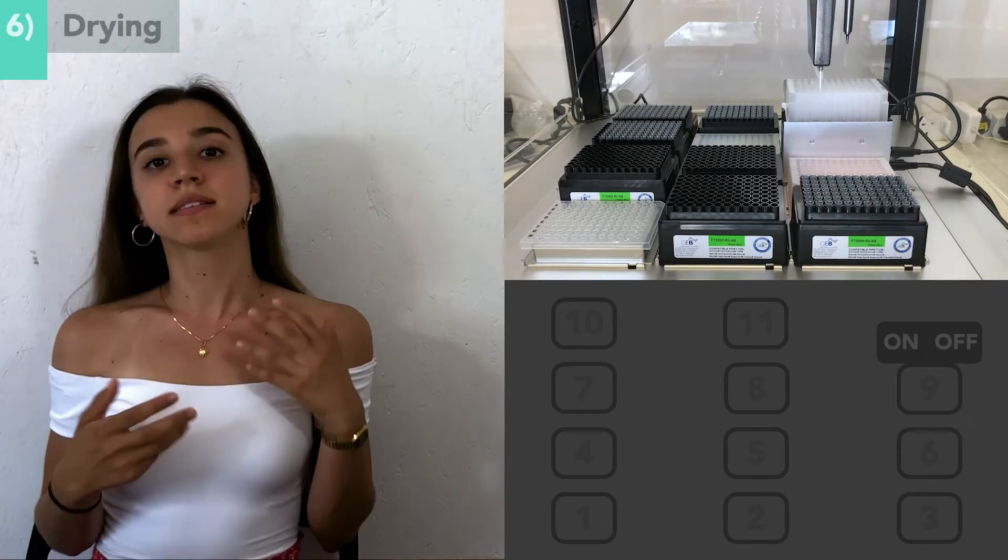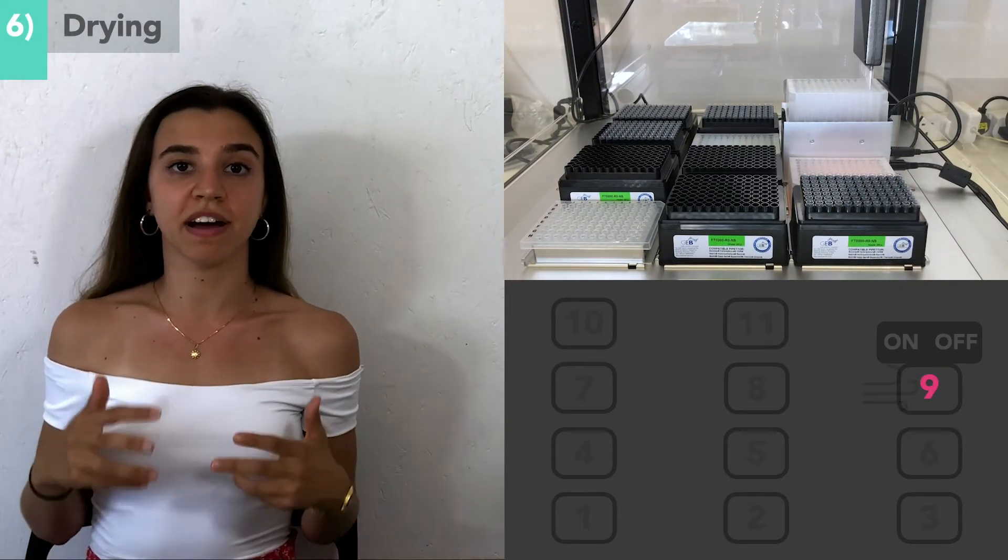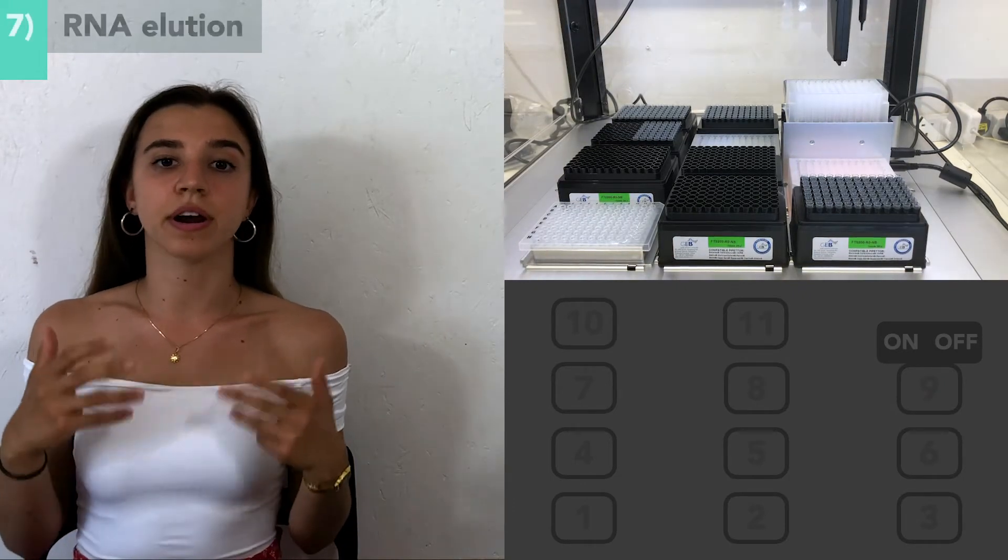The beads are now allowed to dry. This is done by constant pipetting of air over the beads for 35 minutes. After the beads are completely dry, we can elute the RNA.